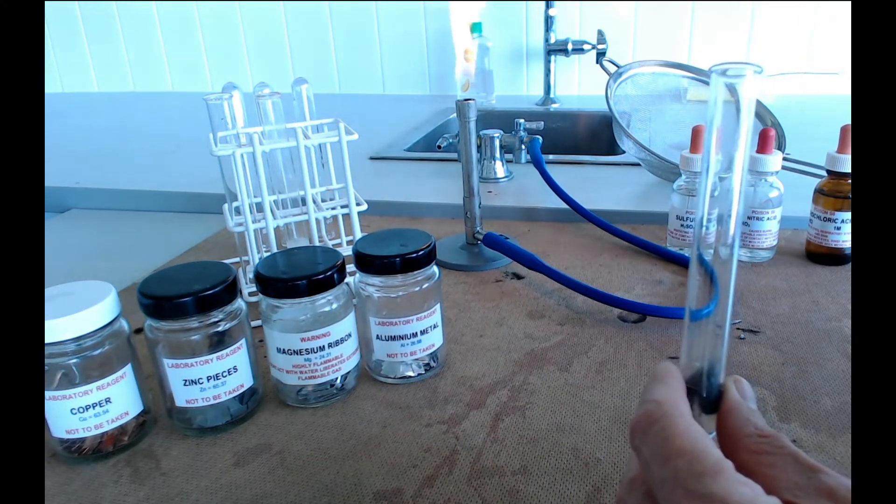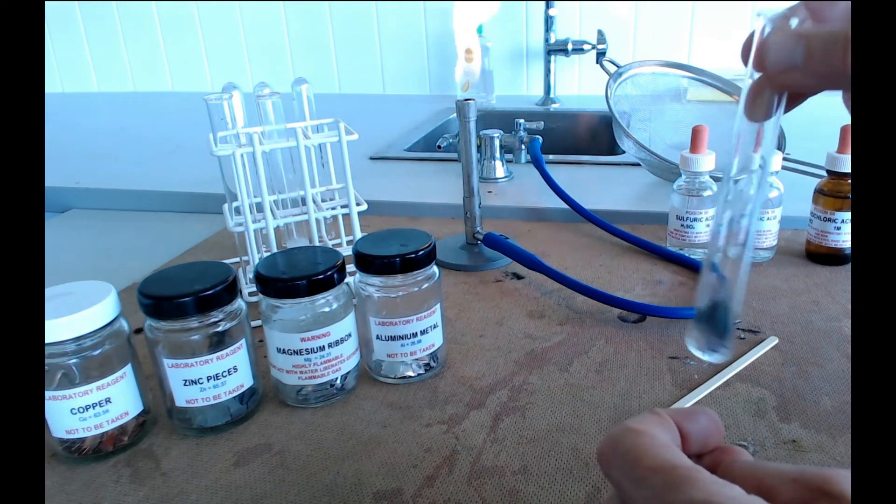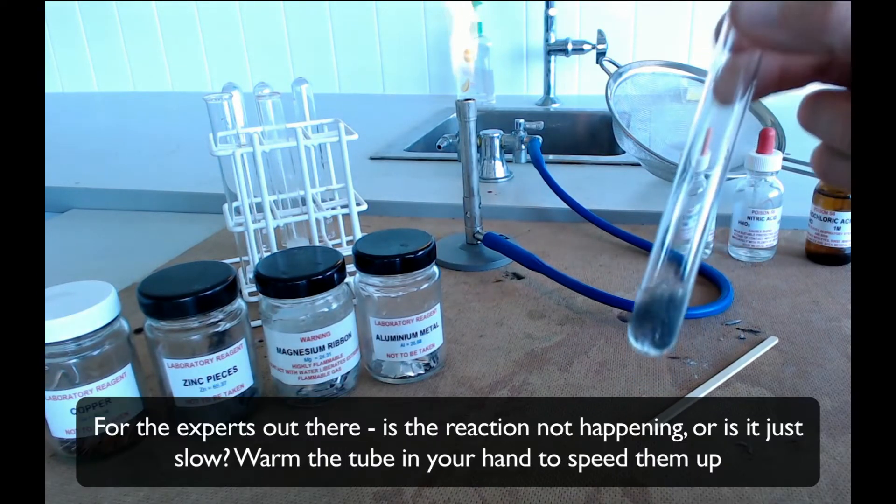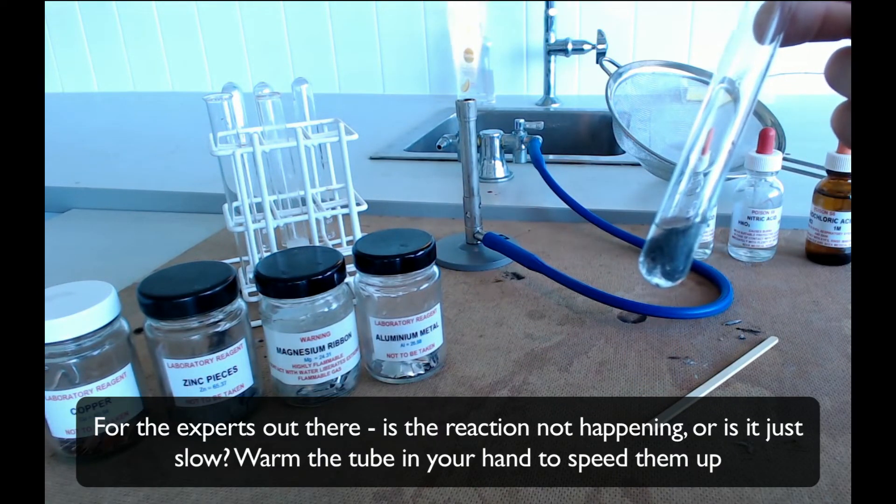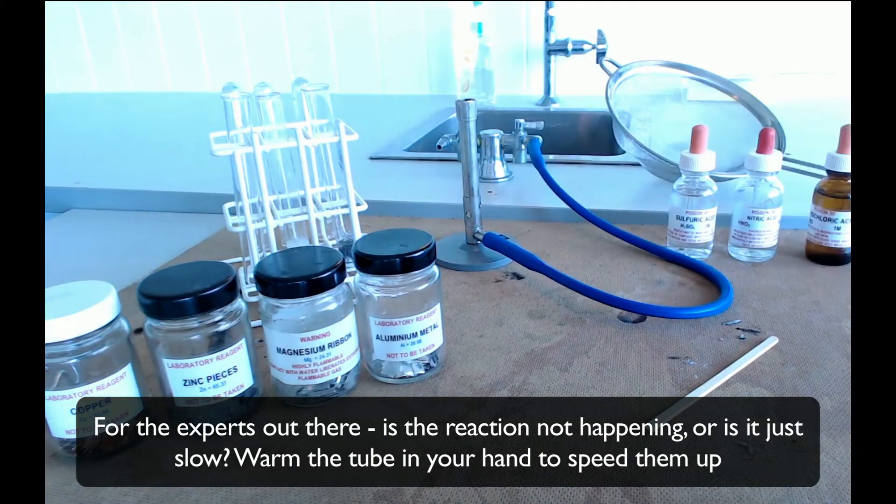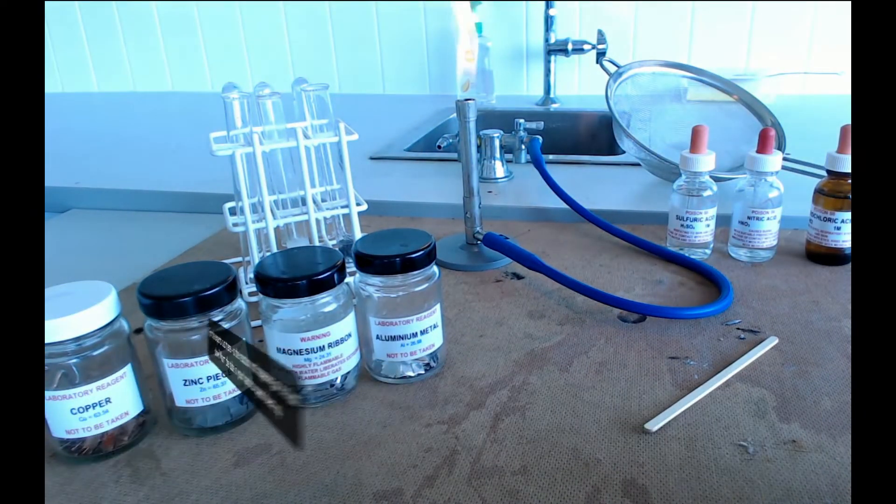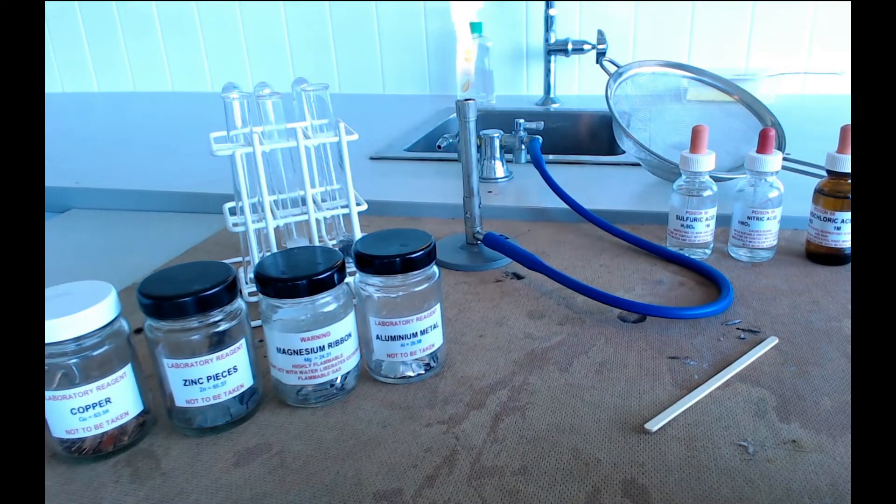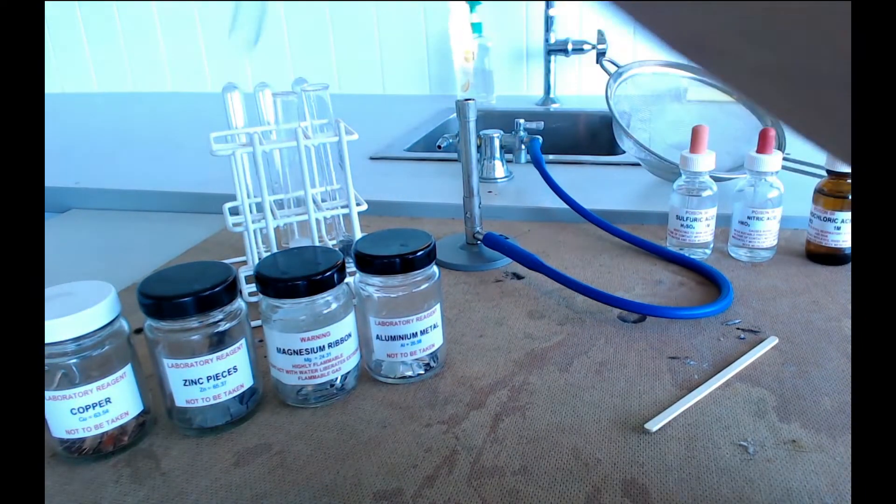And some of these reactions are faster than others. So if it doesn't look like anything is happening straight away just put it in the test tube rack and let it have some time to get reacting. And once you've done that you can move on to your next metal.